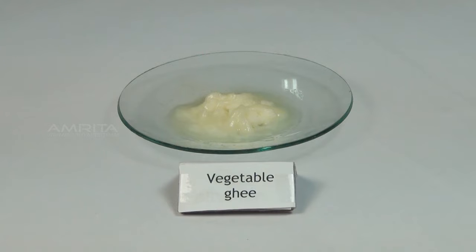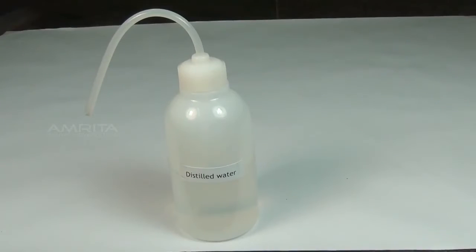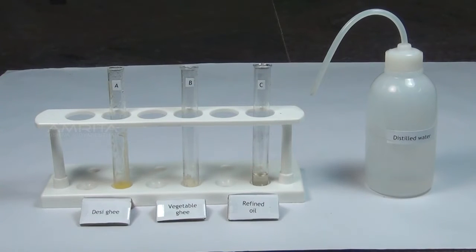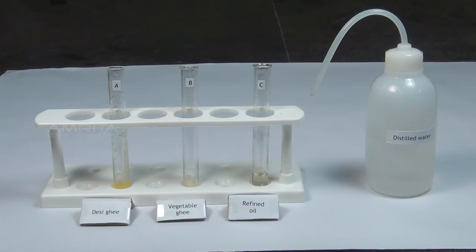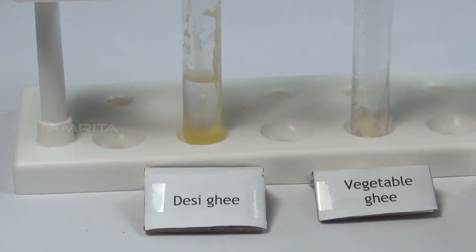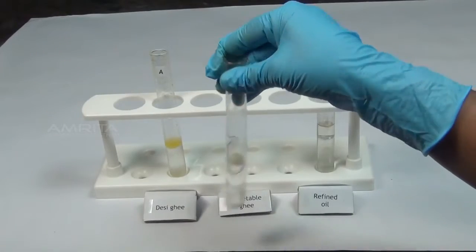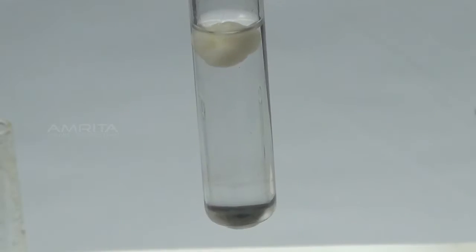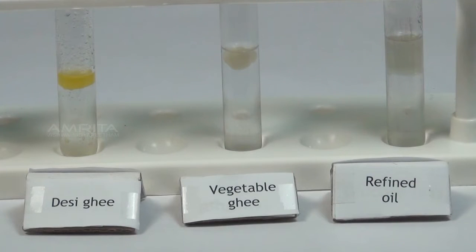Solubility with water. Pour a small quantity of distilled water into test tubes A, B and C. Shake each test tube well. The samples are immiscible in water, indicating the presence of oil or fat in the samples.